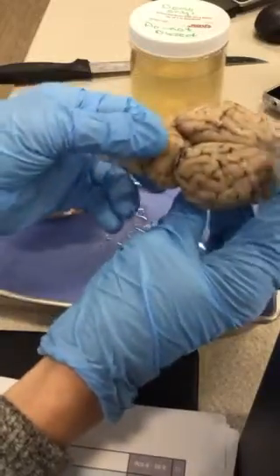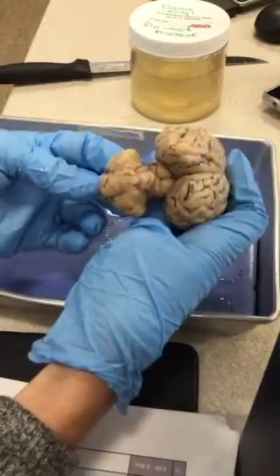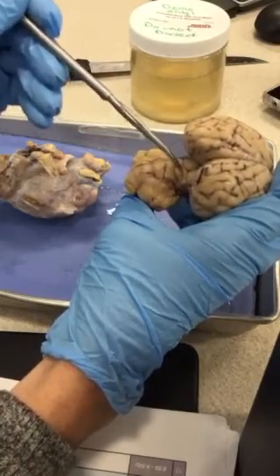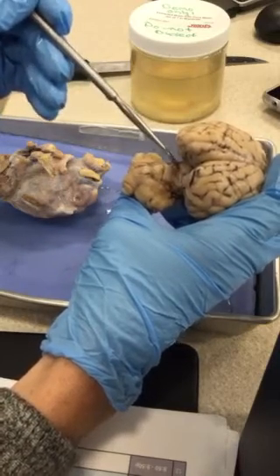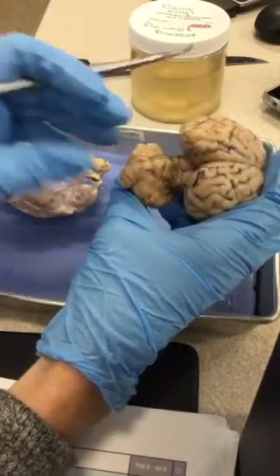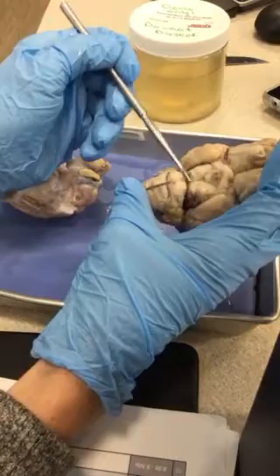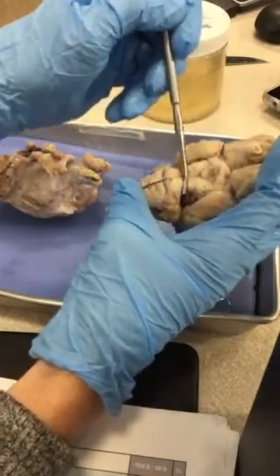Sure, okay. Separate your cerebral cortex from the cerebellum. Do you see the baby's butt that appears in there? If you're really separated, you can see there's 2 top swellings and 2 smaller swellings. This again is the corpora quadrigemina, part of the midbrain. And then if you turn it over, remember those V-like structures of the cerebral peduncles? So here's one swelling of the cerebral peduncle, here's the other swelling of the cerebral peduncles.